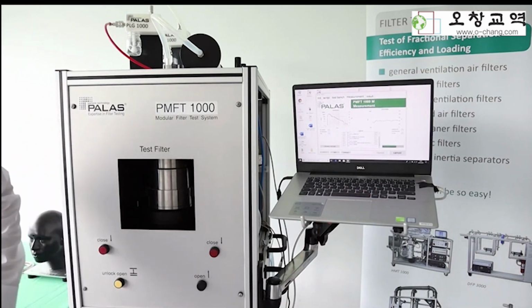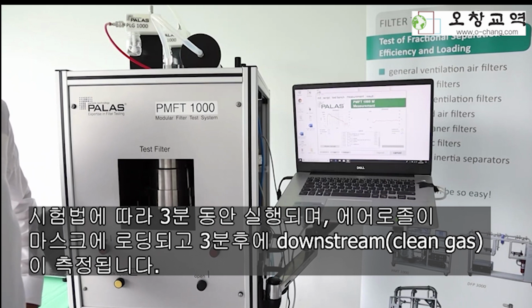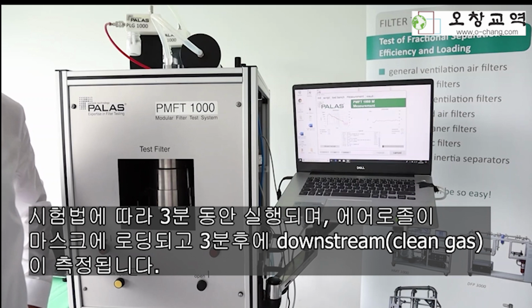Now, according to the standard, this test will run for 3 minutes salt aerosol as a loading on the mask, and after 3 minutes the measurement downstream of the mask, so the clean gas, so to say, will start.